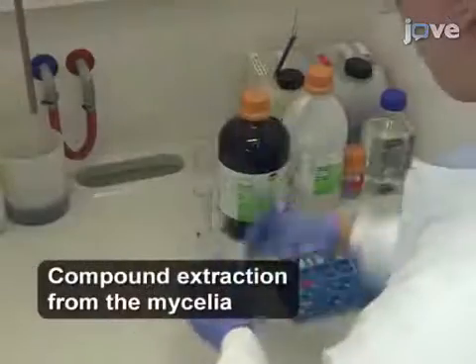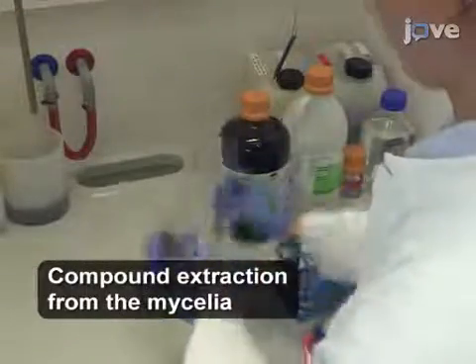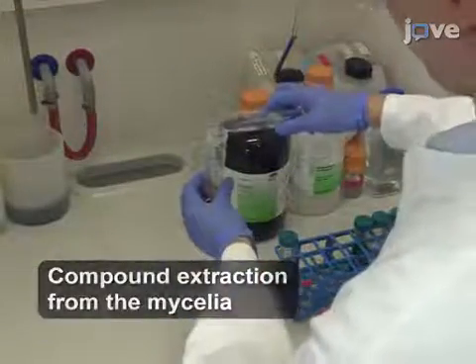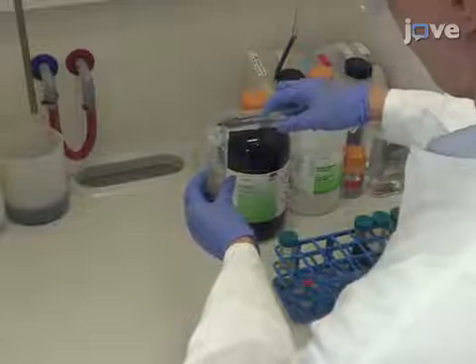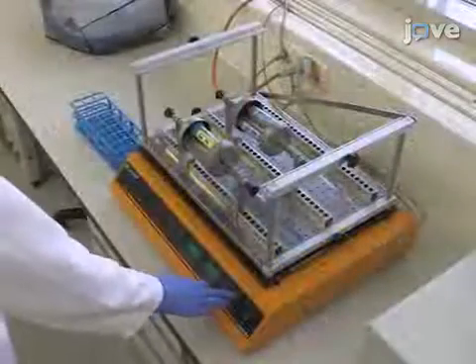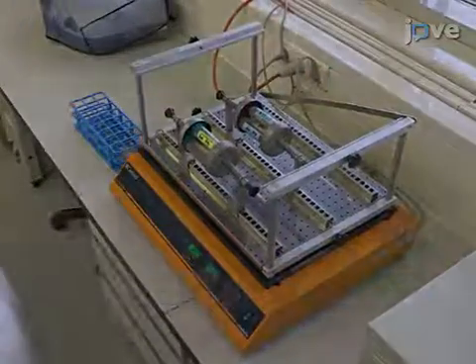For compound extraction from the mycelia, resuspend the cells in a two-fold volume of acetone. Shake the cells in a tube at 180 RPM for 30 minutes.